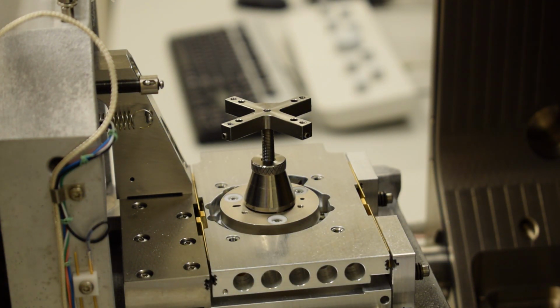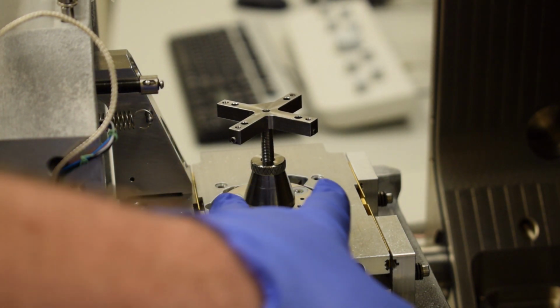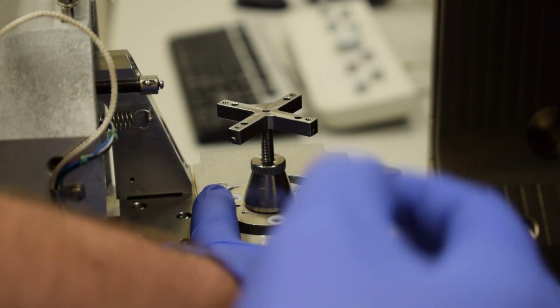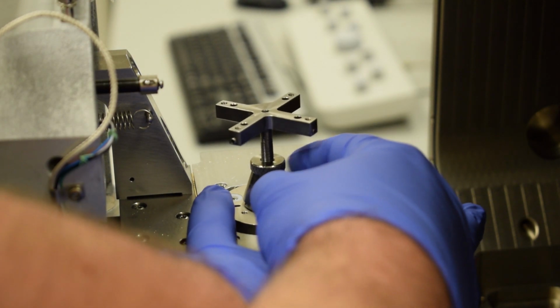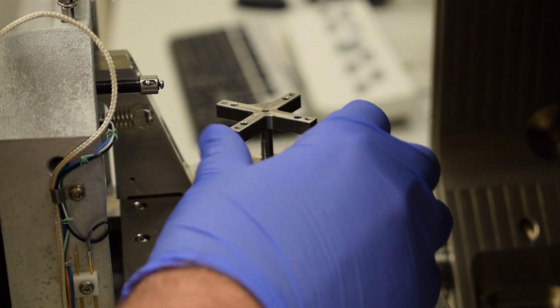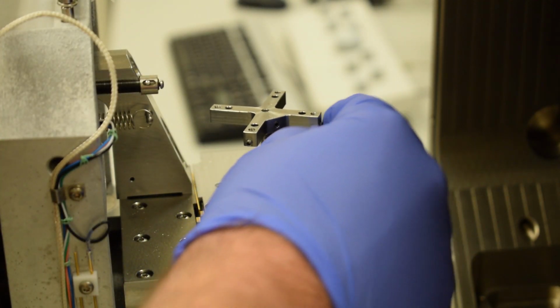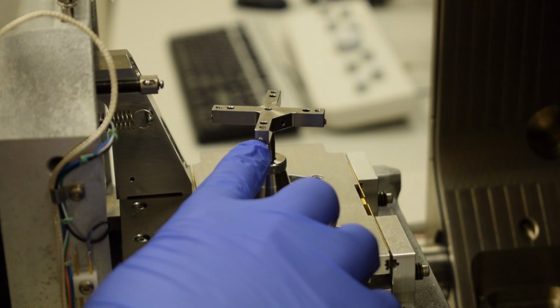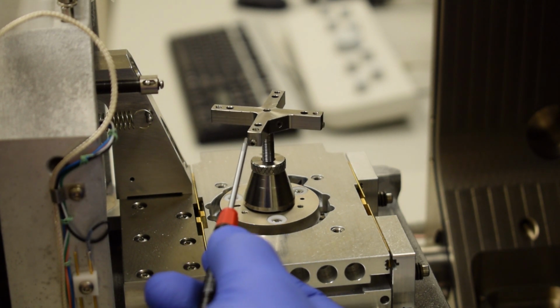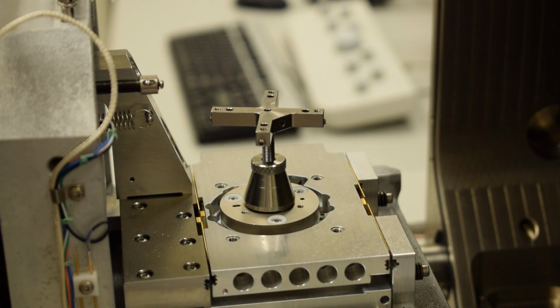If for some reason the last user has over-tightened the locking cone nut, you may have to grab onto the rotation plate with one hand to keep this from spinning and loosen the cone nut with the other hand. But that is not a typical situation. So once the cone nut is loose, we can now spin the stage adapter to any position that we want. This is useful because it allows us to access the small 1.5 millimeter set screws on the perimeter of the holder, which are used to secure the samples.